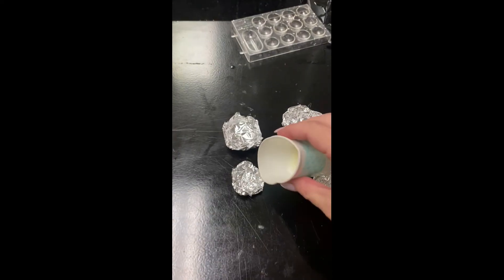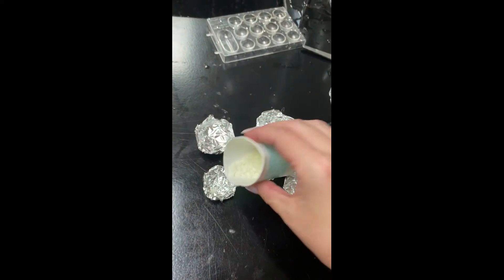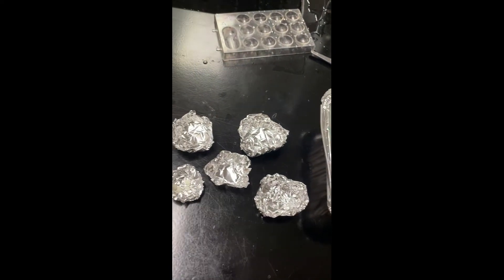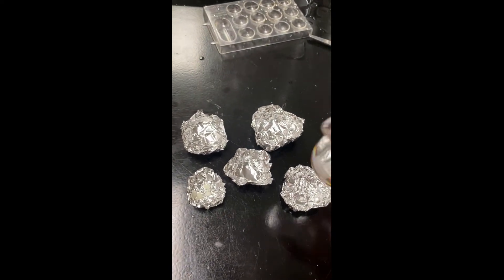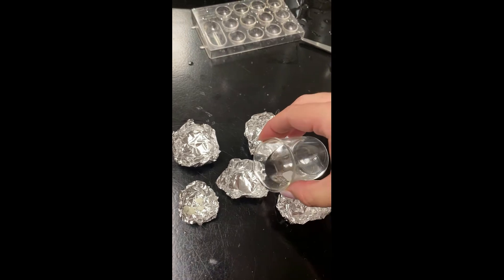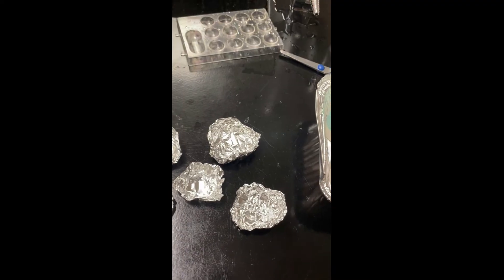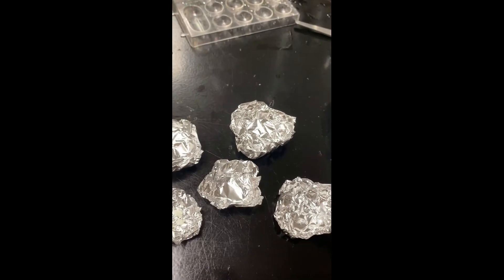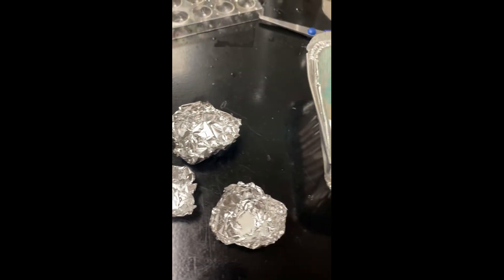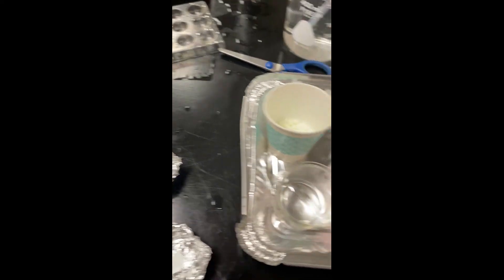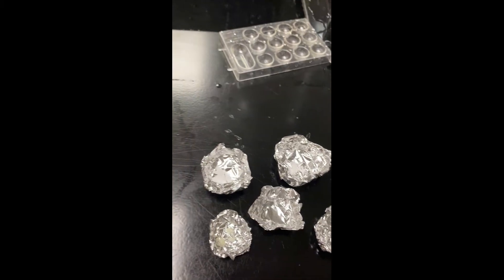Okay, now it's time to check and see how long it takes each of our substances to melt. So go ahead and get your little aluminum foil bowls out and put about a very small portion into each one, a little bit bigger than a grain of rice size if you can. It doesn't have to be absolutely perfect. Just try to do your best with this. Make sure you make note of what sample is going into which little bowl so you can accurately depict what is happening here as you start to place them on the hot plate and see them melt.